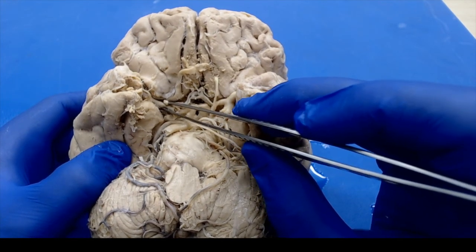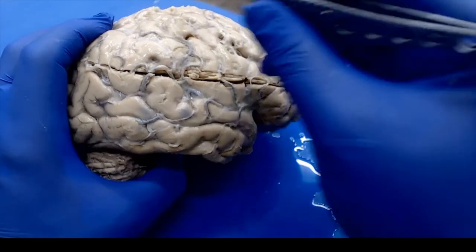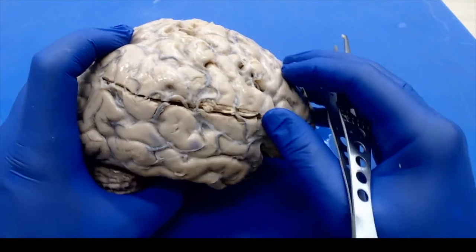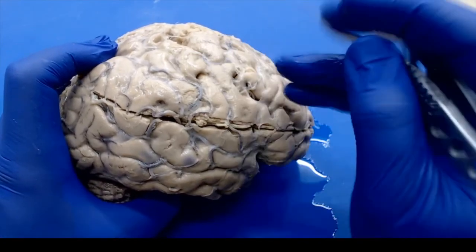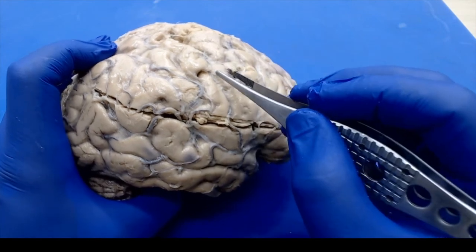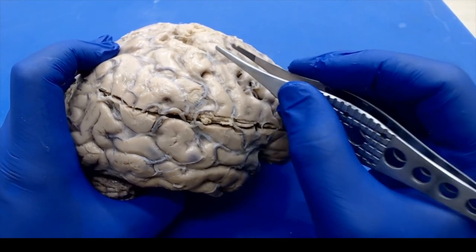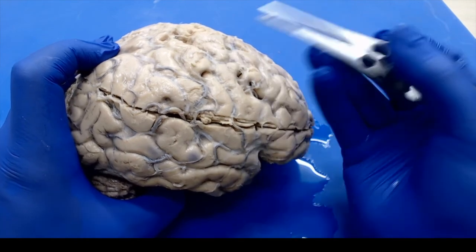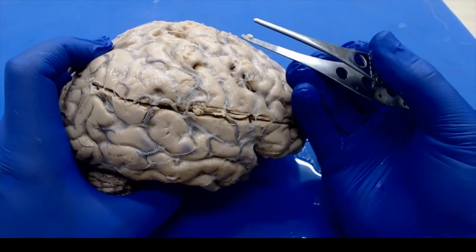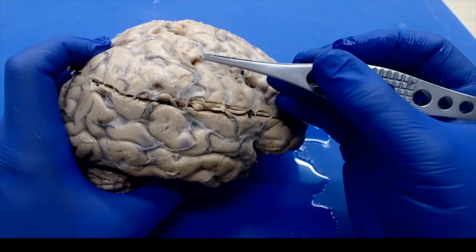And what that generally supplies is this parietal lobe here. And if you remember, we talked about how most of our motor and sensory functions exist in the parietal lobe, and particularly that pre and post central gyrus. Well, if we get an infarct there, that's when we start manifesting symptoms of the stroke. They could be sort of defects in our sensory or defects in our motor skills.